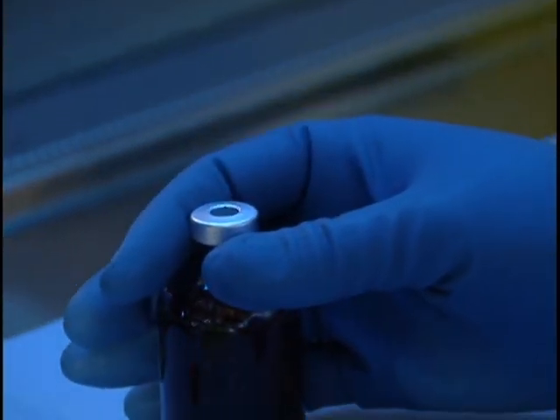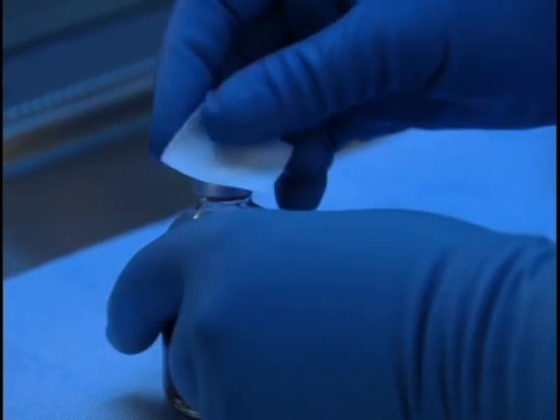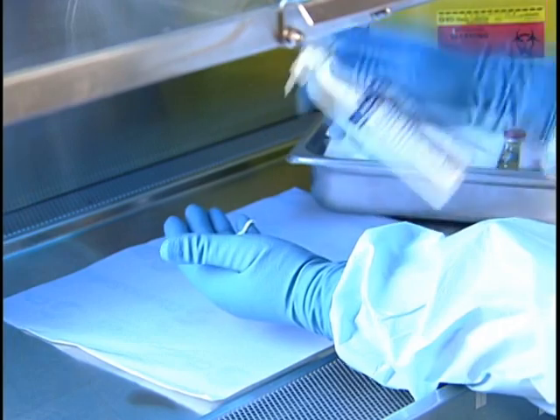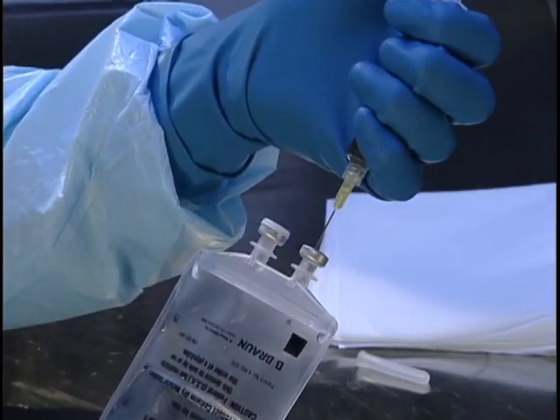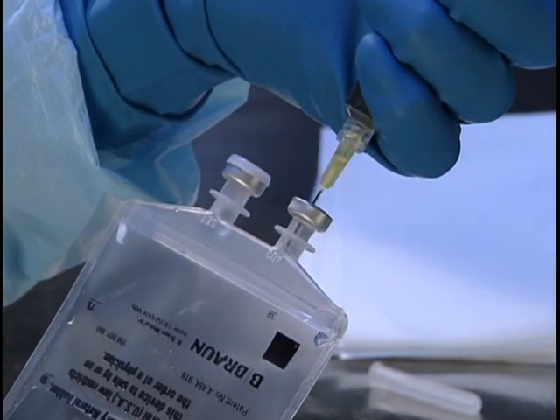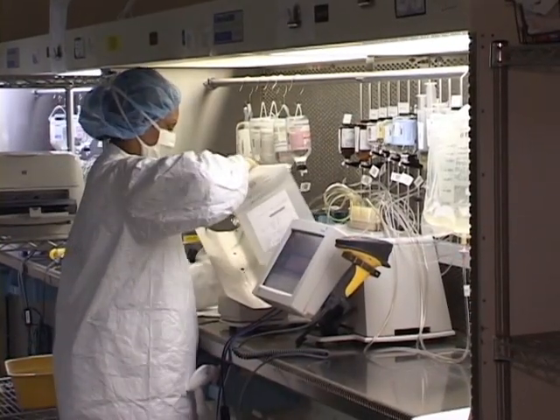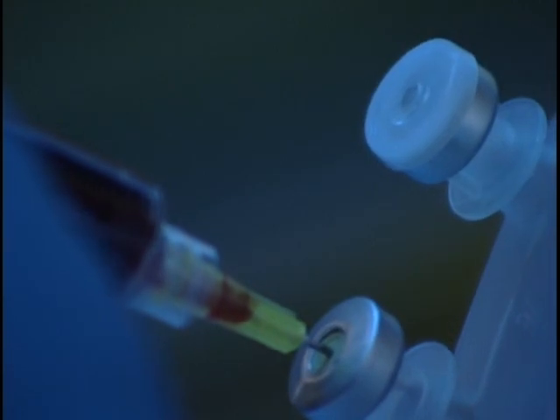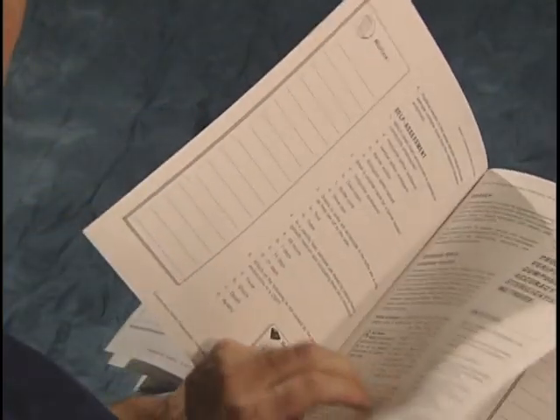Good aseptic technique begins with you. To protect exposed sterile preparations, personnel are expected to consistently maintain sterile gown quality and aseptic technique standards. Wearing protective clothing helps contain both microorganisms and non-viable particles that are generated by employees. Clean, low-lint garments must be worn when preparing sterile preparations. Your facility will provide appropriate gowns for this purpose. Clean room attire may vary based on the type of preparation being prepared, specifically whether personnel are compounding hazardous or non-hazardous drugs.